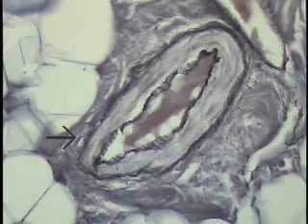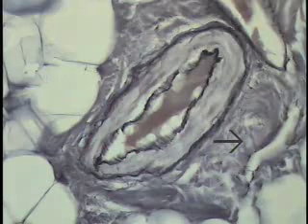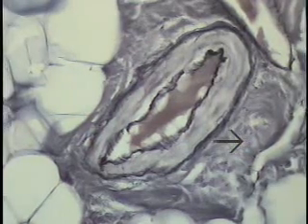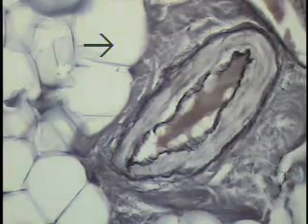This is an additional small artery as stained with an elastin stain to demonstrate clearly that this small artery, seen at increased magnification or a fairly high magnification, retains its internal elastic laminae. This particular vessel maybe has 3 or 4 smooth muscle wraps, and even at this particular point, the external elastic laminae is present, and then the surrounding adventitia. I'll move this field slightly so you can see fat cells coming into the field of view to give you a frame of reference for the size of this particular vessel, which is a fairly small artery.